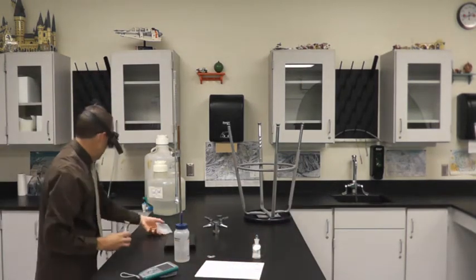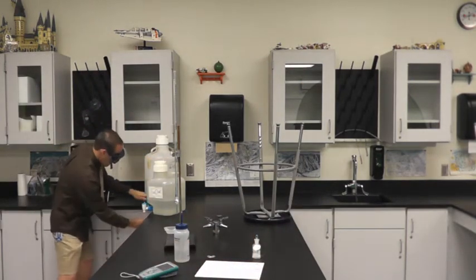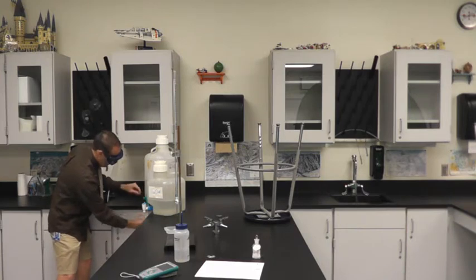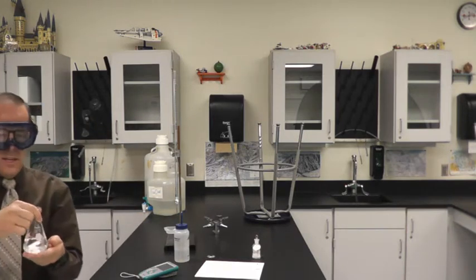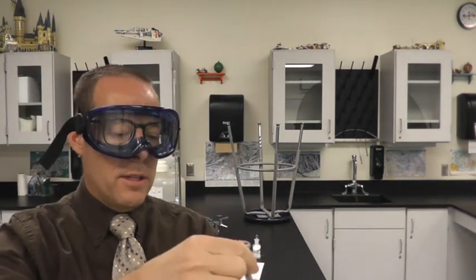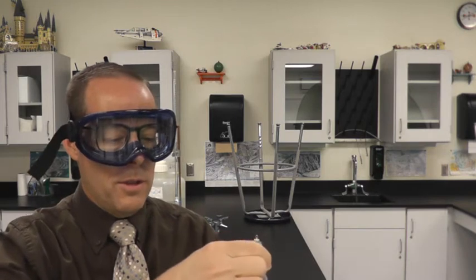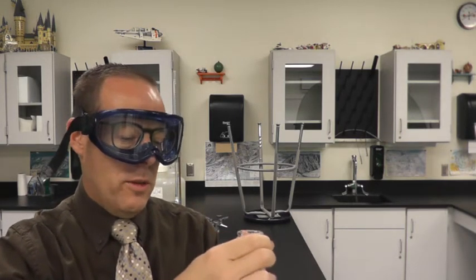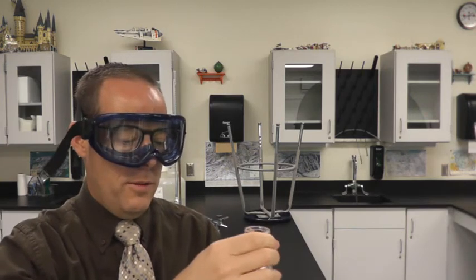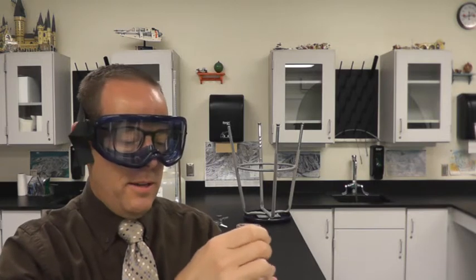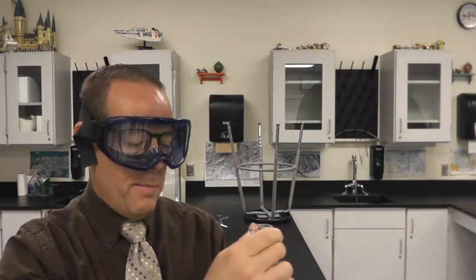And then over here, I have NaOH in this container and over here I have just some distilled water. So I'm going to add water. It doesn't matter how much I add. I just want to add enough so that my KHP dissolves. So I'm going to swirl it around for a little bit just to make sure that it dissolves. And unfortunately KHP is one of those things that it can take a little while to dissolve. So I'm going to pause the video probably right here and wait for this to dissolve. And I'll be right back.